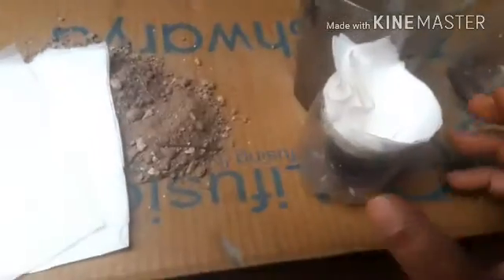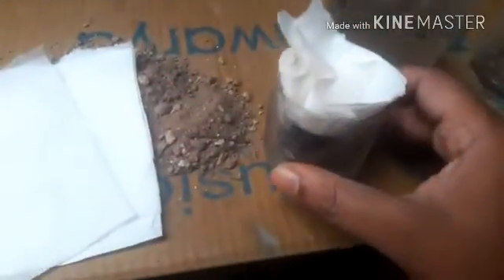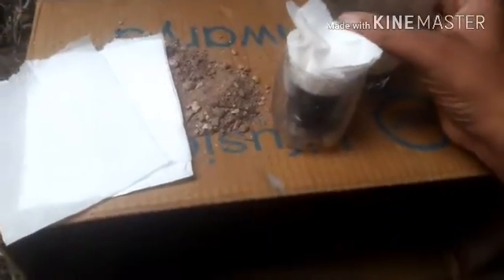And we have to fold it to prepare a round funnel-shaped structure, right? Actually I have to use 2 hands, so I'm using the selfie camera. And look here, the funnel that I made, I inserted it in this, right? And I'm keeping this filter paper in the funnel, right? Now I have inserted it in the funnel. So let us see the decantation process.